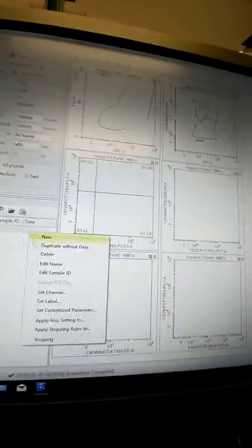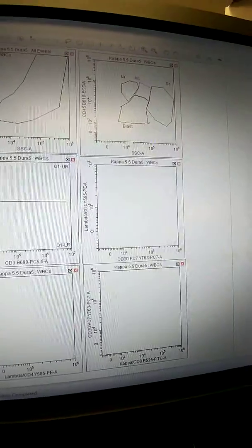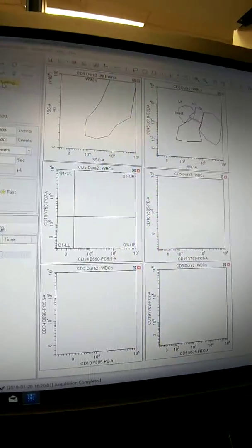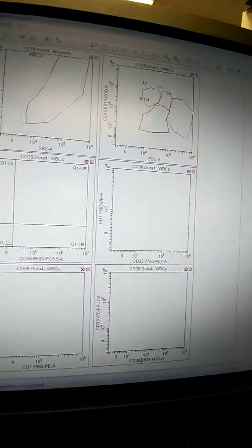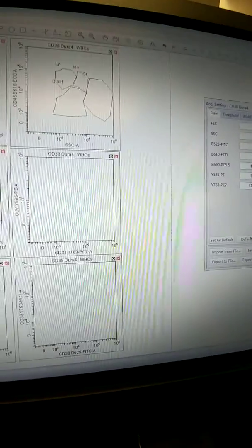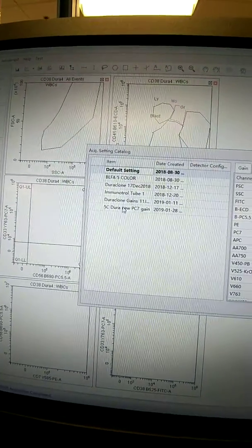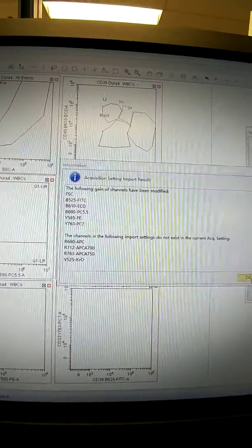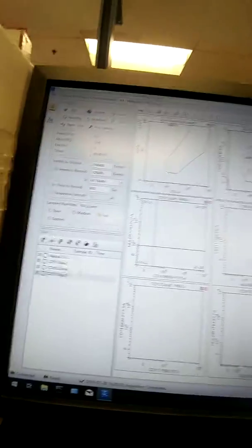And then just to make sure, I'm going to apply acquisition settings to all the tubes. For some reason, my tube 3 is not showing up there. So what we'll do here is just, well, let's go ahead and, okay, that's the correct settings. What about down here? Acquisition. Okay, those are even more different. So I'm going to do import from catalog, the same thing, click those, import. It's changing a lot. I must have mixed and matched templates at some point. Okay, and then that's the correct one. Okay, so now all 4 tubes have the correct acquisition settings in there and the right compensation that I want.